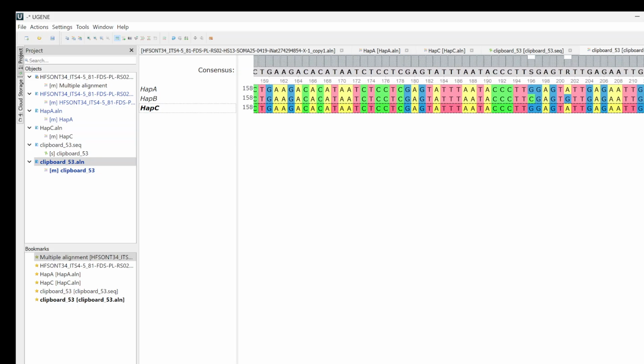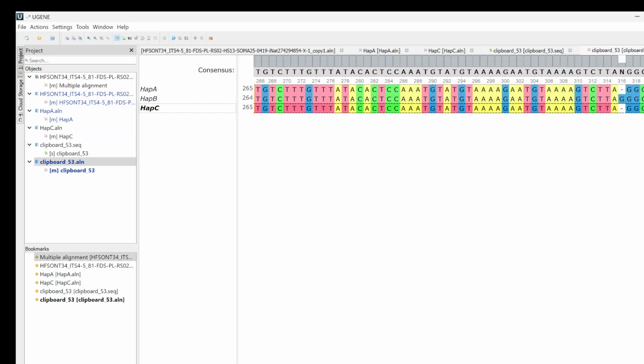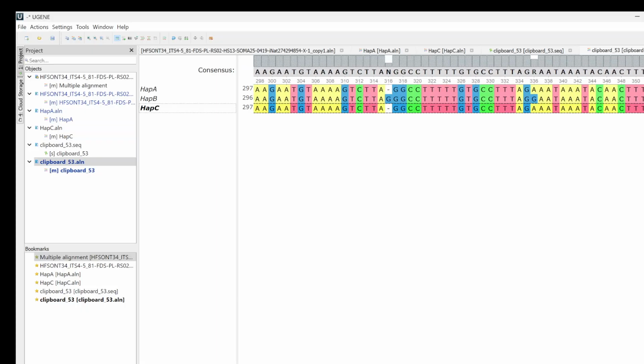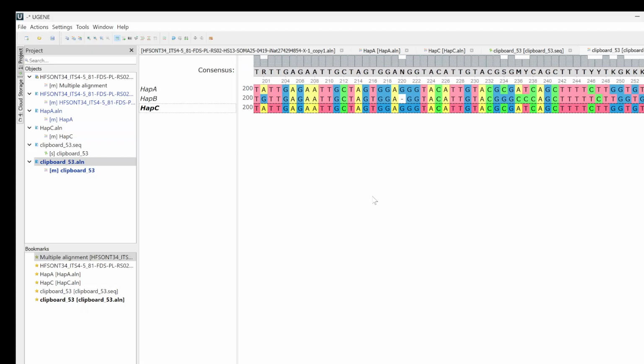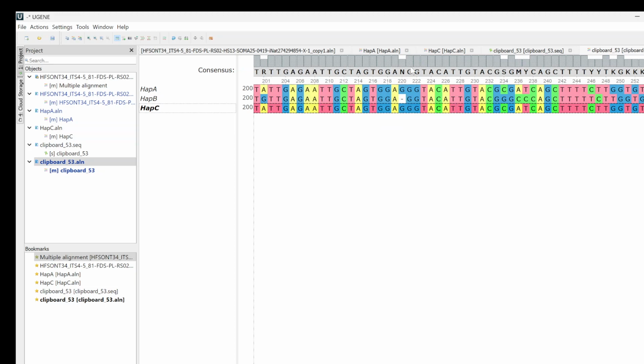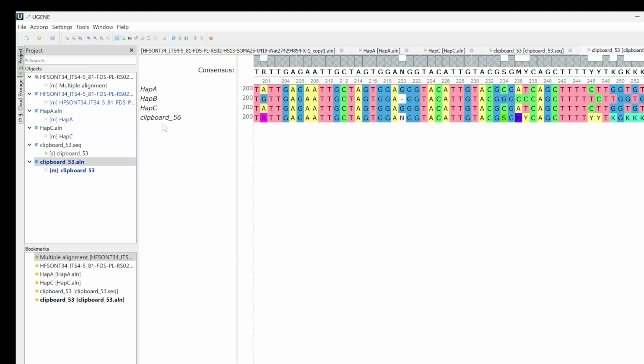So, in some of them, they've got gaps. Some of them have different nucleotides. It's pretty polymorphic. It's kind of cool. So for our main consensus sequence, we will go and we will copy this consensus. And so we're going to have to replace the N's with the requisite nucleotide. So we can just paste it in here.